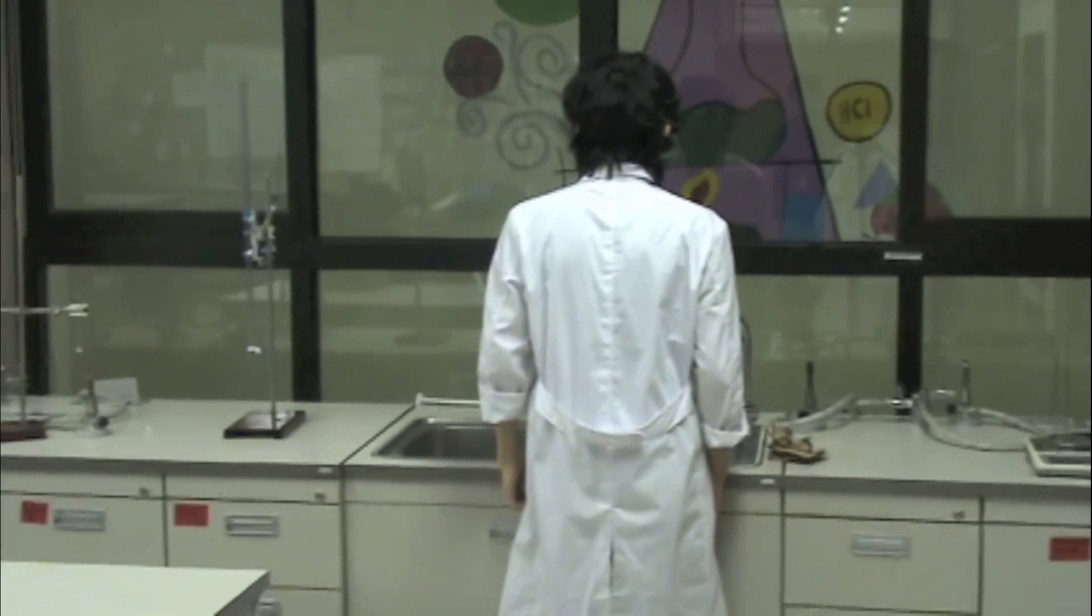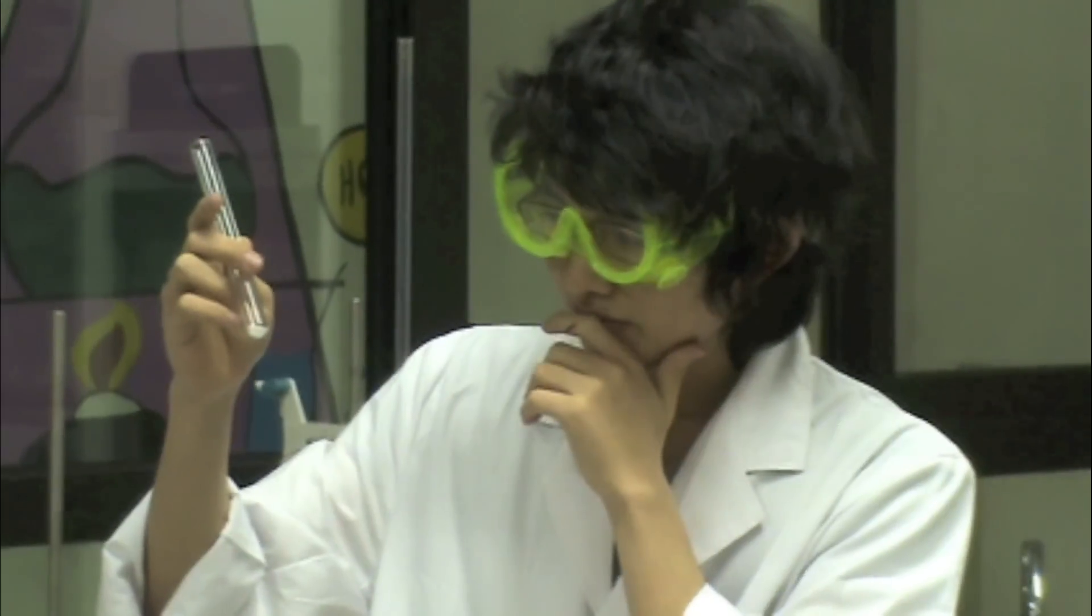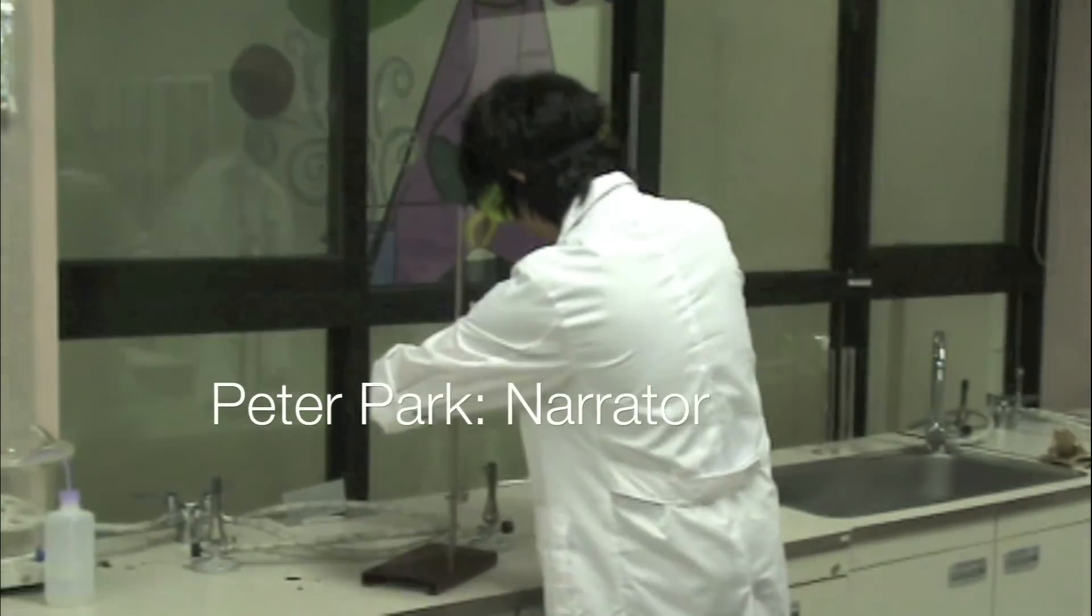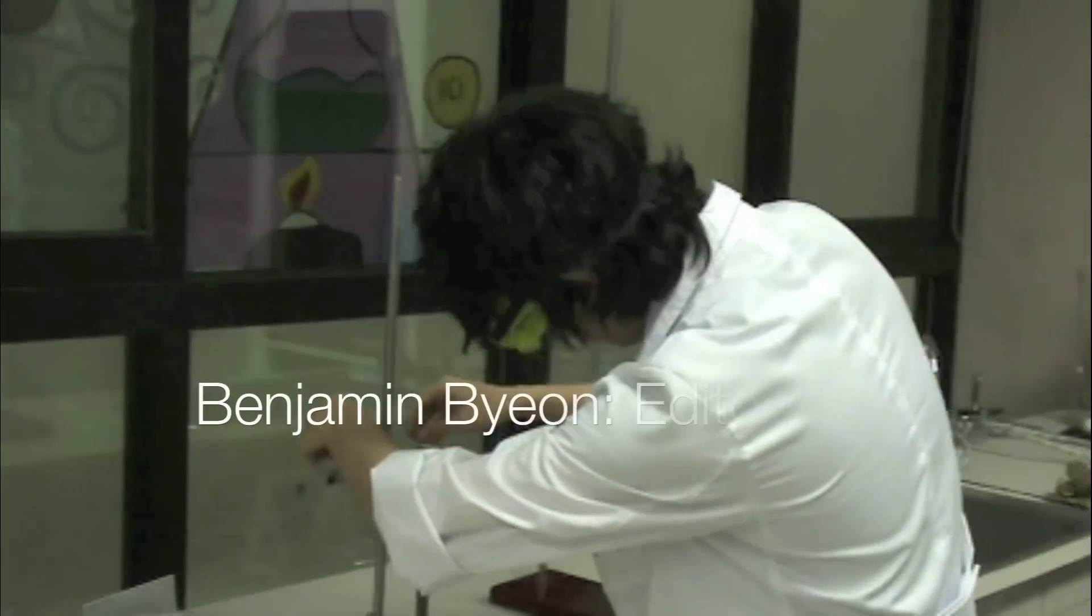Meet Billy, an amateur scientist who needs to heat a sample of hydrated copper sulfate for his chemistry experiment. Confident and enthusiastic, Billy thinks he has the right way of doing it.